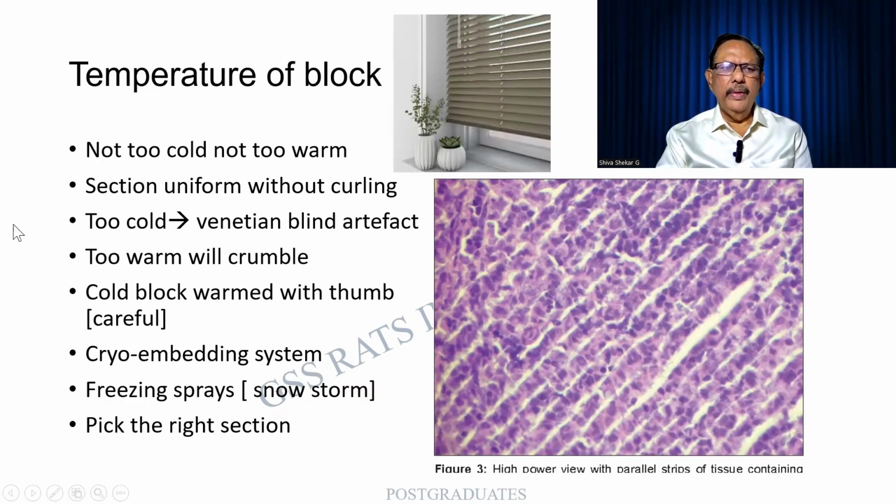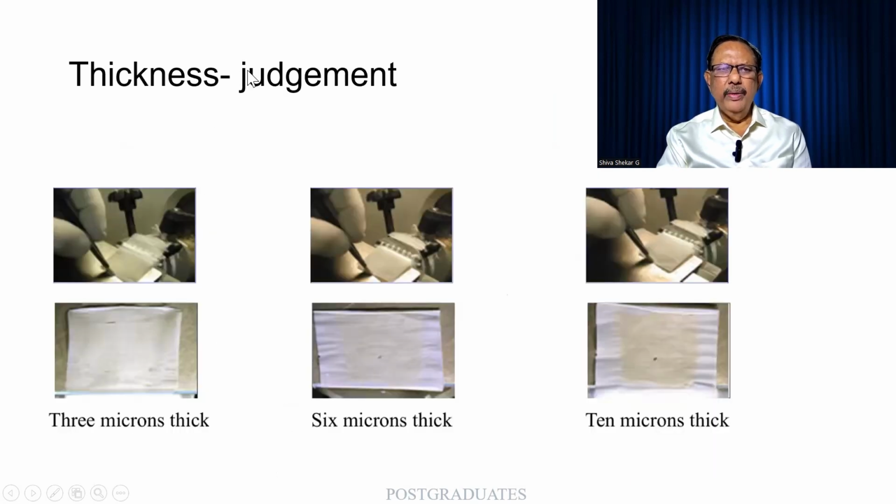Temperature of the block. It should not be too cold or too warm, and there should not be any curling. When it is too cold, there is something like a Venetian blind, as over here. Look at this one, it exactly matches. And I am finding artificial cracking of the tissue. So there has to be a cryo-embedding system at almost the same temperature. Sometimes freeze sprays are used. And you will have to pick up the right section.